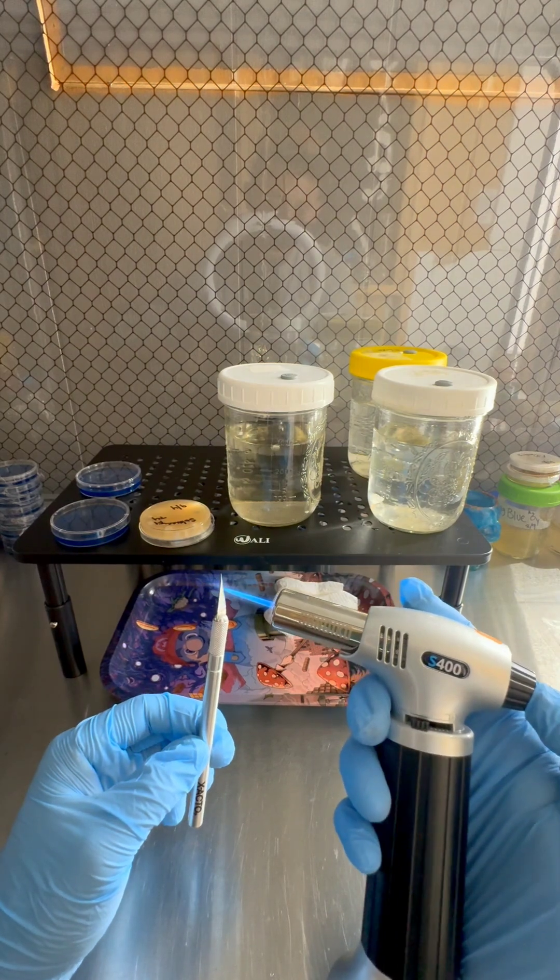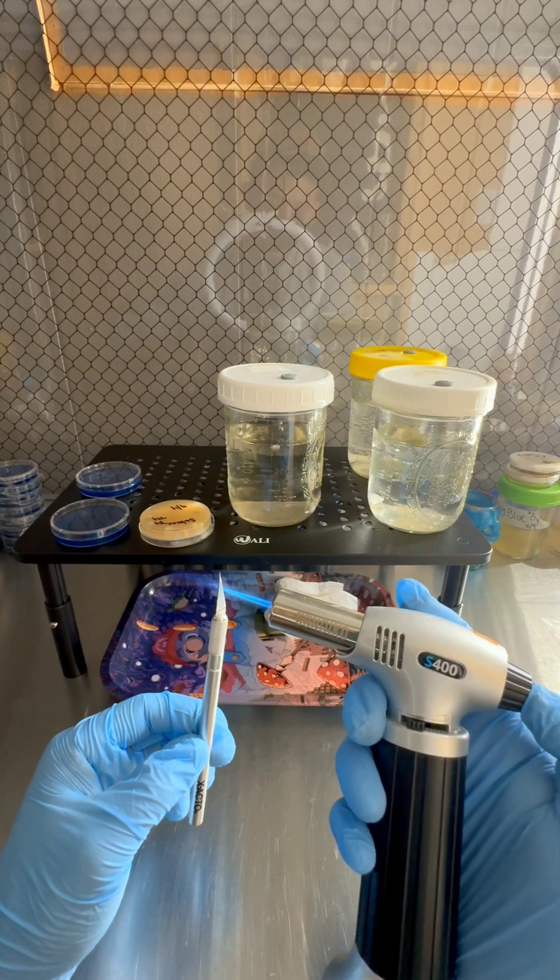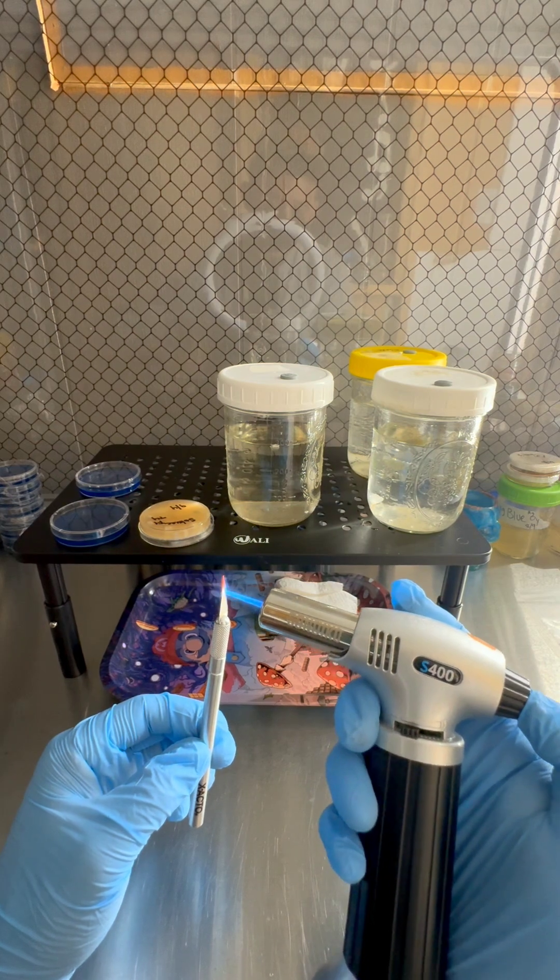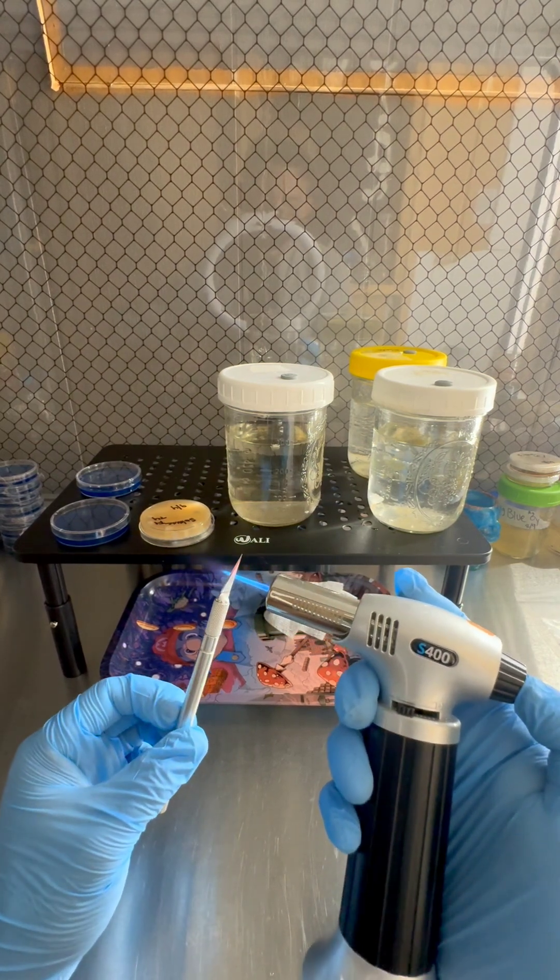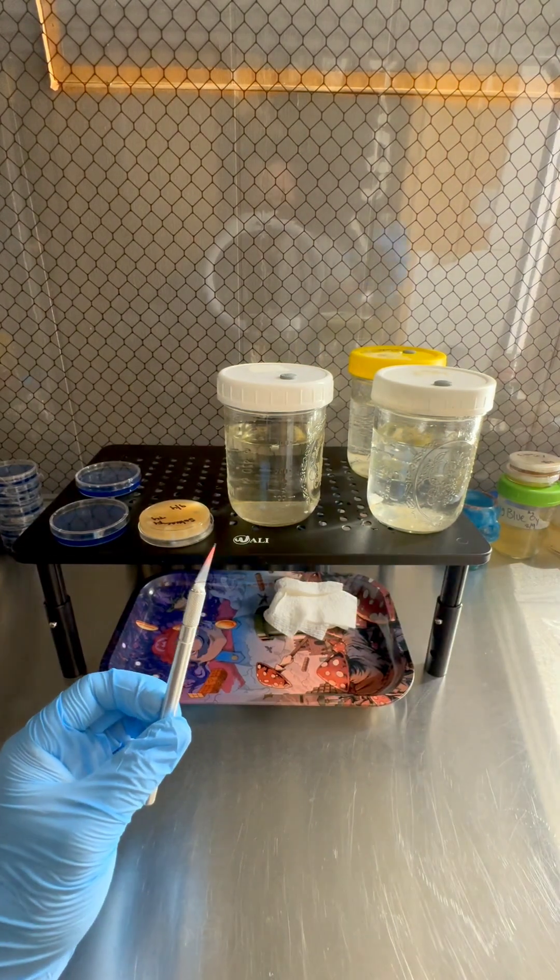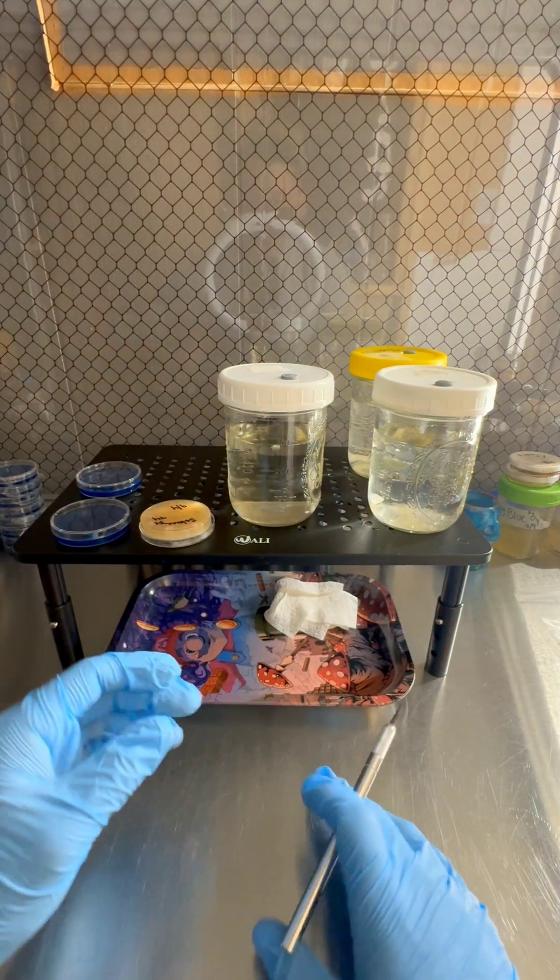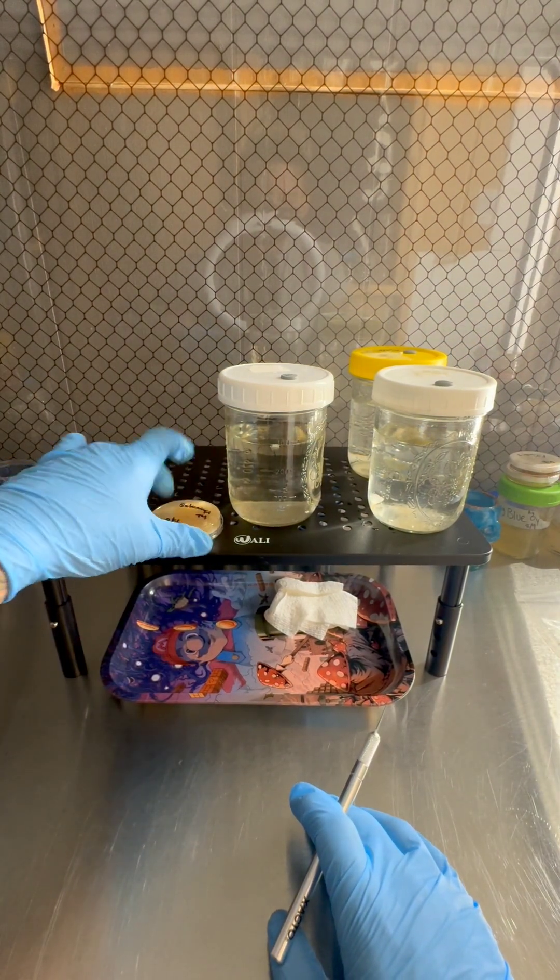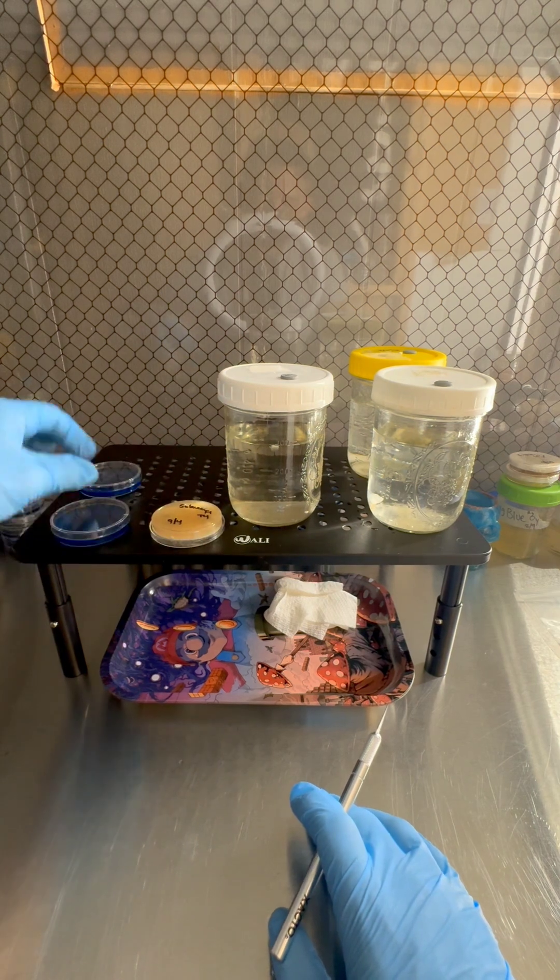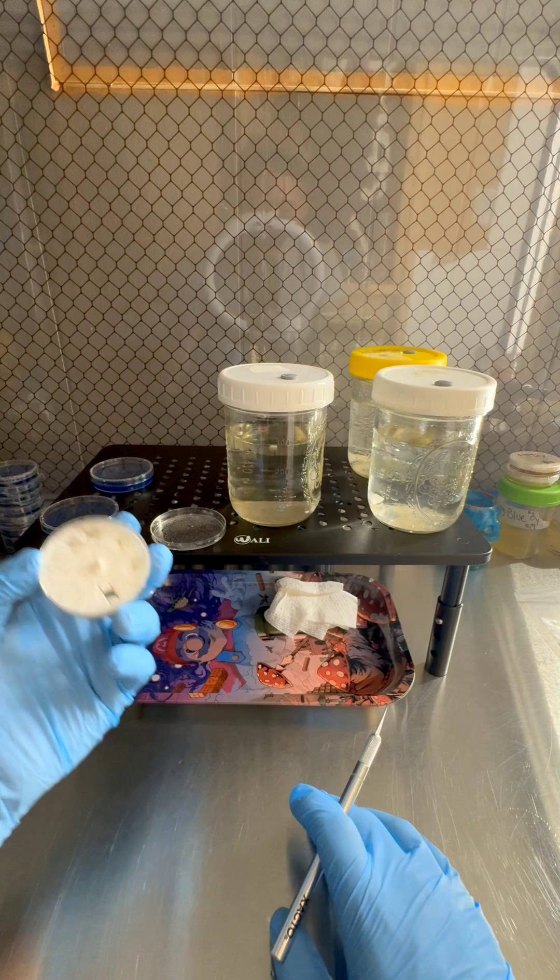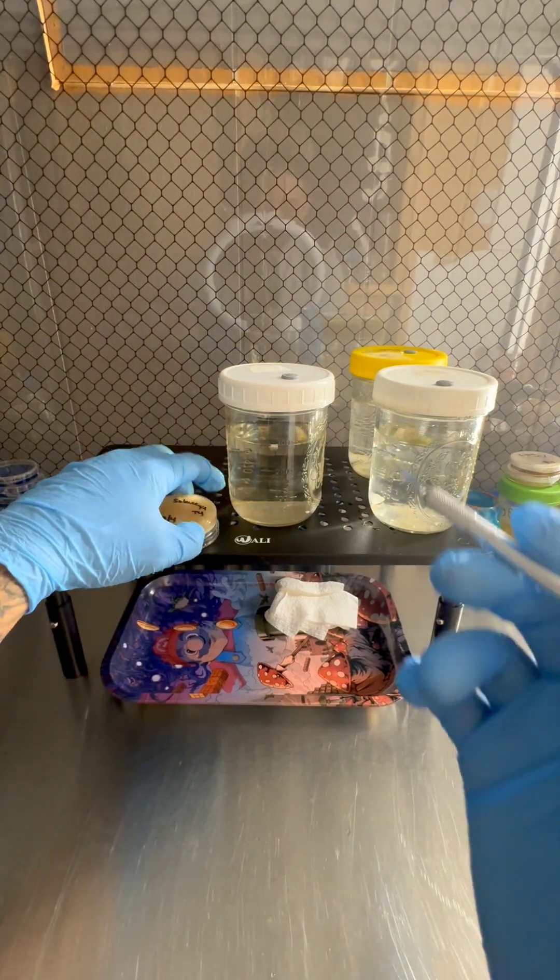And all I'm gonna do is transfer a couple pieces of mycelium off of this petri dish onto some fresh agar. And all that's gonna do is extend this culture and make it fresh. I'm gonna just have fresher genetics on it. Just make sure this is cool.